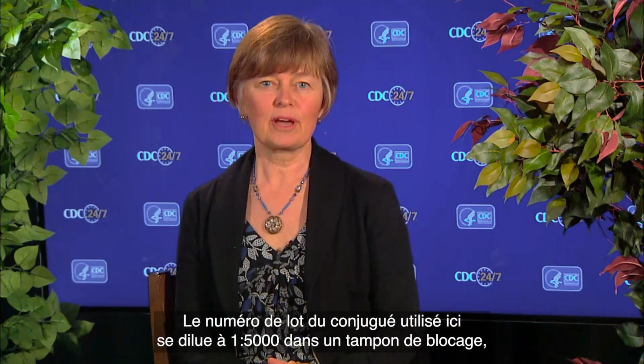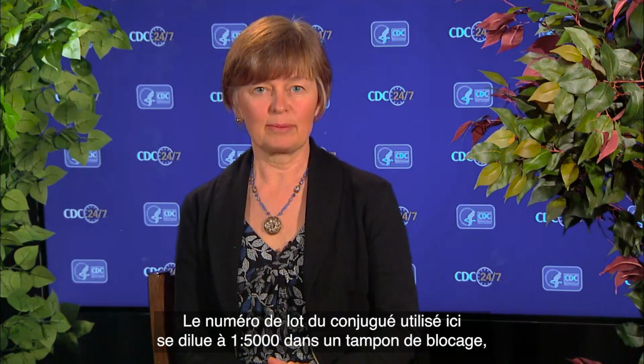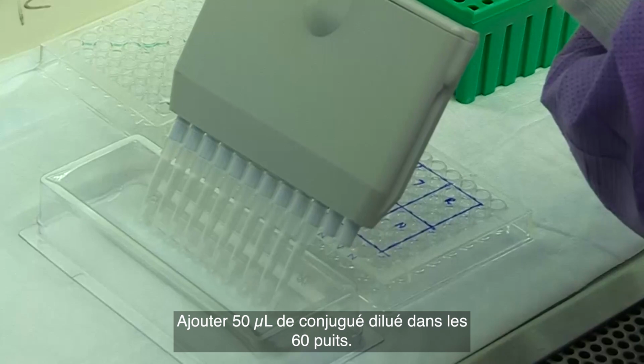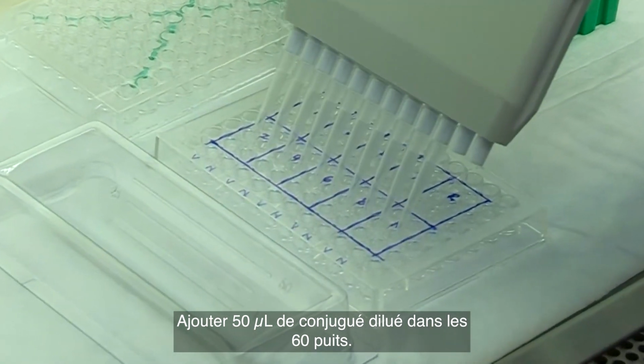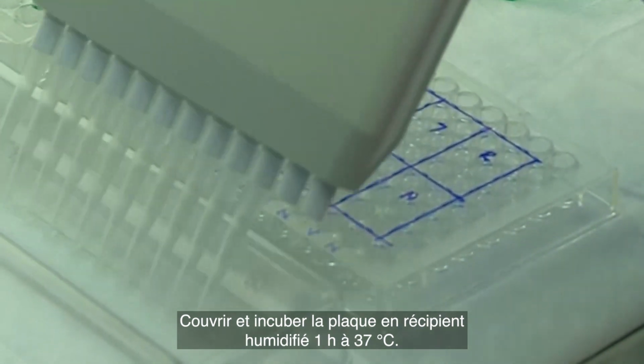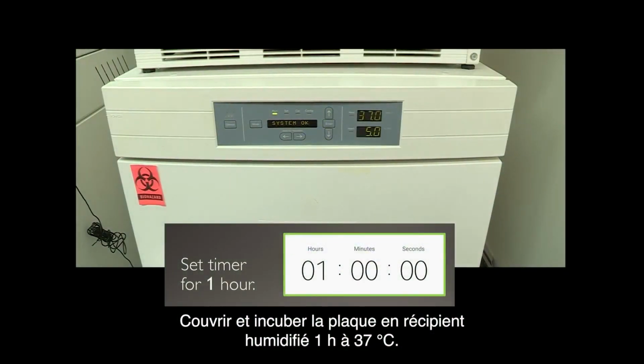The lot number of the conjugate used here is diluted 1 to 5,000 in blocking buffer, which is 1 microliter in 5 ml of blocking buffer. Make this dilution shortly before use and do not store. Wash the plates. Add 50 microliters of diluted conjugate to all 60 wells. Cover and incubate the plate in a humidified container at 37°C for 1 hour.